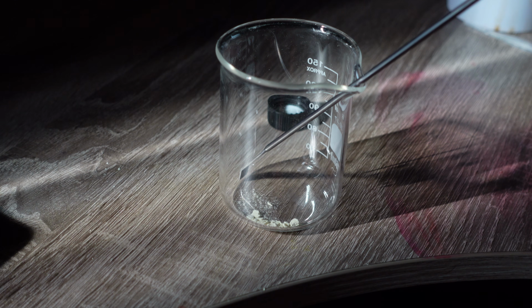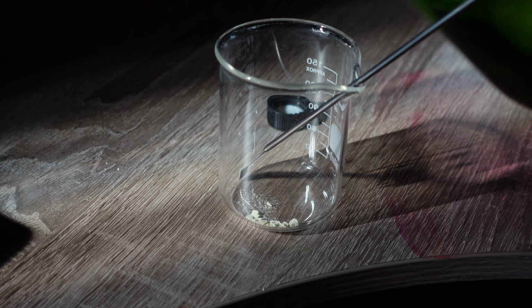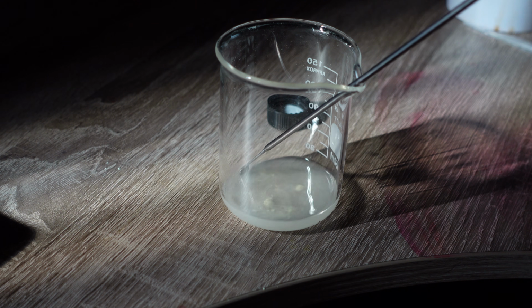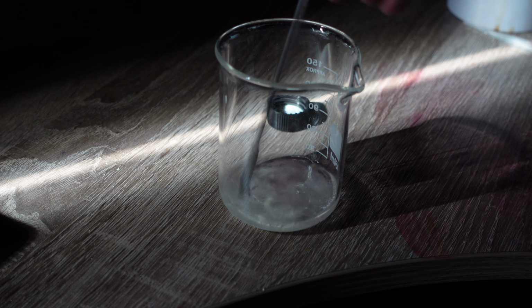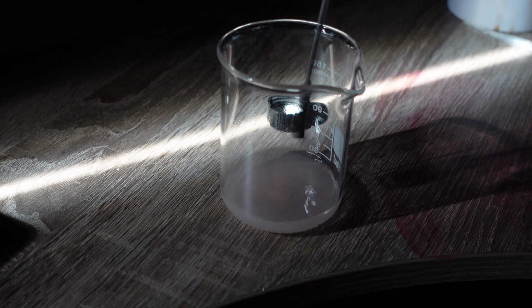So, here's the reaction itself. I take 100 milligrams of dinitrophenyl oxalate, add 10 to 15 milliliters of ethyl acetate. It doesn't dissolve completely, which is normal. It's not supposed to. Then, I add a very small amount, literally a tiny bit on the tip of a spatula, of the fluorescent dye Rhodamine 6G.